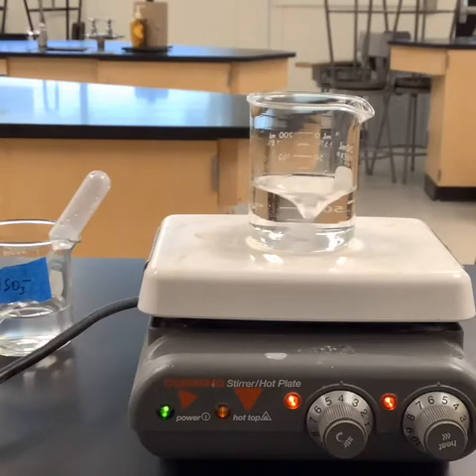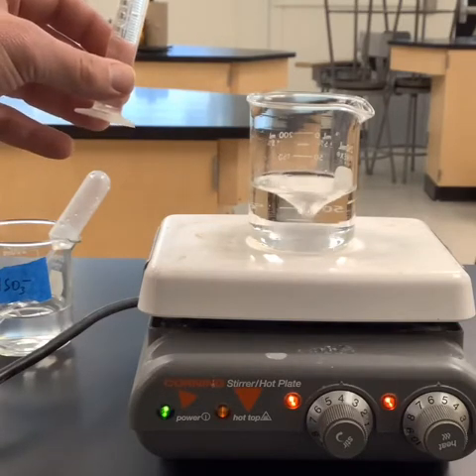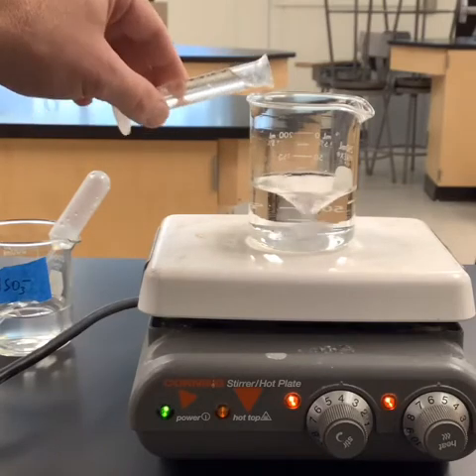Waiting for that to be done. Okay. Here we go.